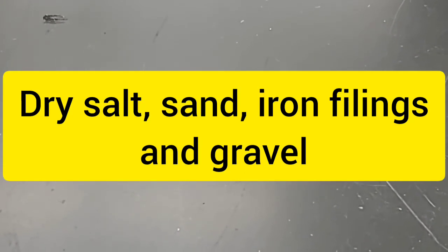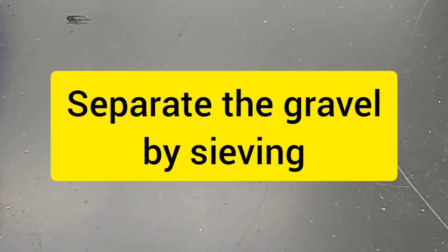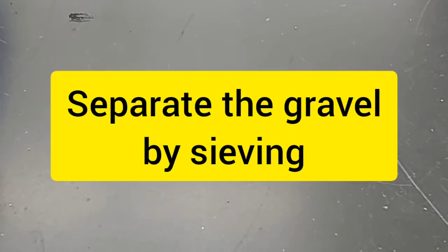The next one, number 4: mix dry salt, sand, iron filings, and gravel together using the materials at hand. Plan and conduct an experiment to separate the 4 substances. Okay, so we have the dry salt, the sand, the iron filings, and the gravel together. Now, based on the mixture, which do you think will be the first one that we need to separate? Okay, of course we have to separate the gravel. Gravel, these are crushed stones. Okay, these are pieces of stones.